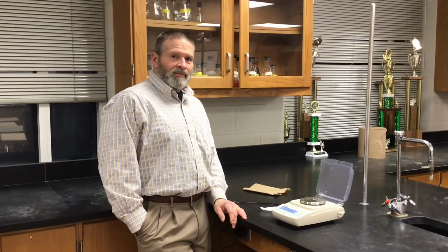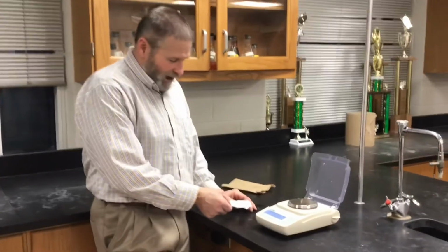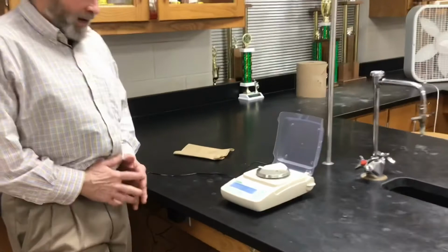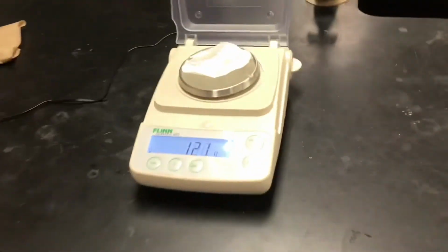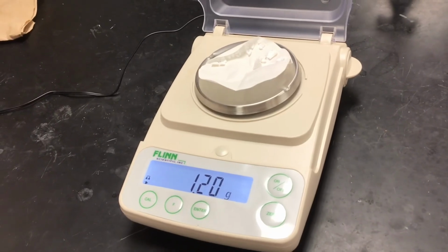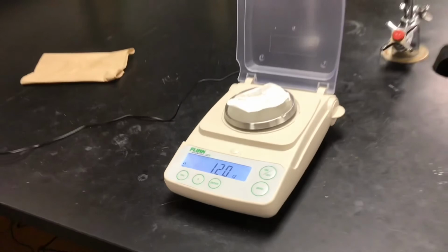Mr. Hevel, 3 days later. Mr. Moore, that's right. Monday morning. And our filter paper and precipitate is dried. And so we just need a final mass reading. Oh, I've got this glare. Okay, yep. 1.20 grams. I think that's all we need. We can find our percent yield now with that. Okay.